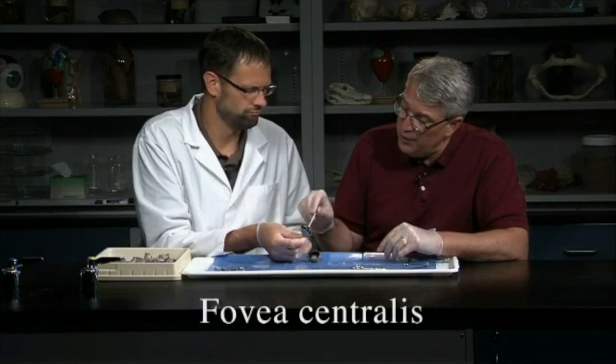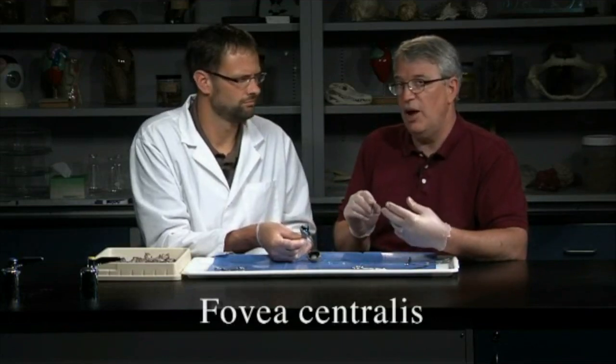And something like the books might have something about the fovea centralis or macula. Yeah, and you can't really see those. The fovea centralis is an area in the human eye that has a high concentration of cones, which allow for very high visual acuity, and for color vision. And it tends to be an area where light tends to be focused a lot. But it's such a small structure you can't really see it with the naked eye. But it would be on the retina, in an area with a lot of photoreceptors, cone photoreceptors.